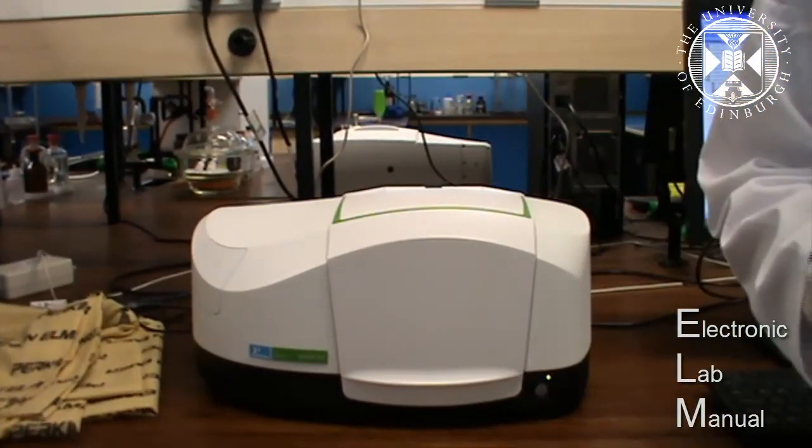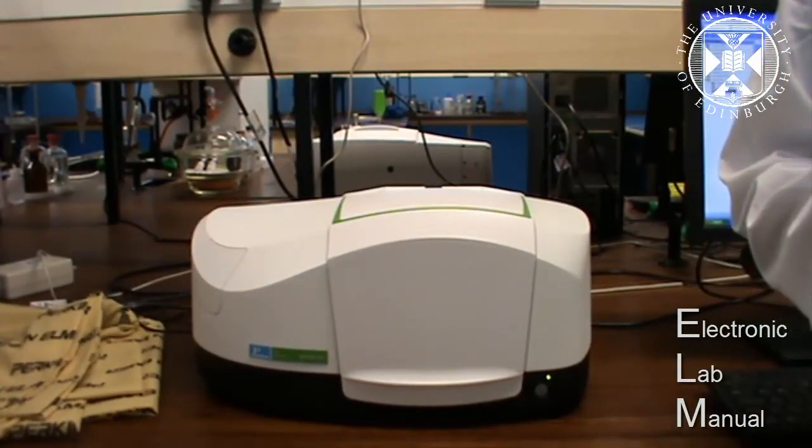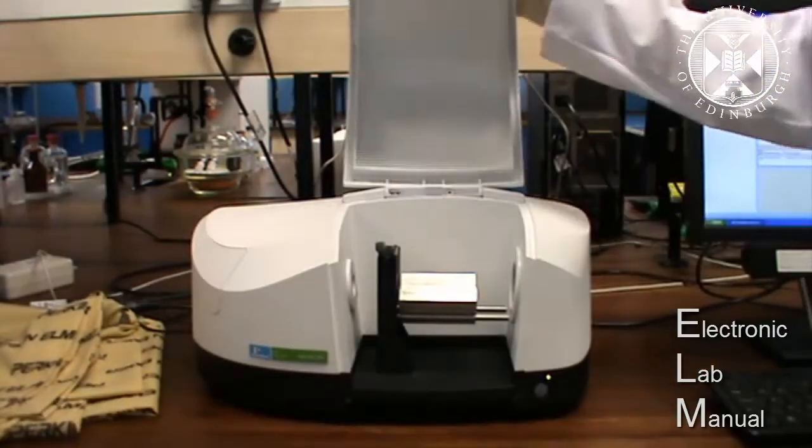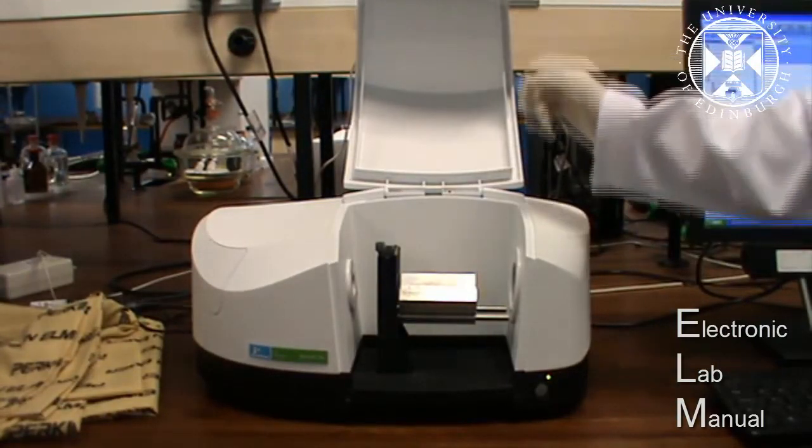Okay, so to run the spectrometer, both the blank and for the HCl, we've got the spectrometer here and it will have the setup inside like this. Just make sure it is set up like this.